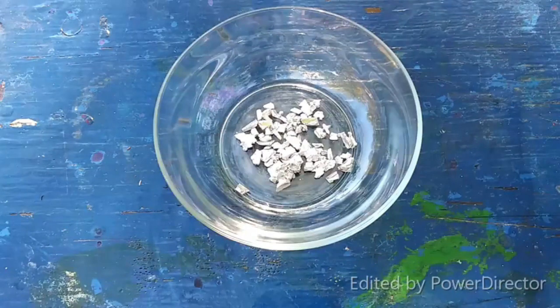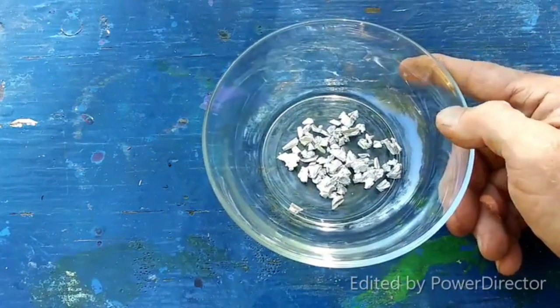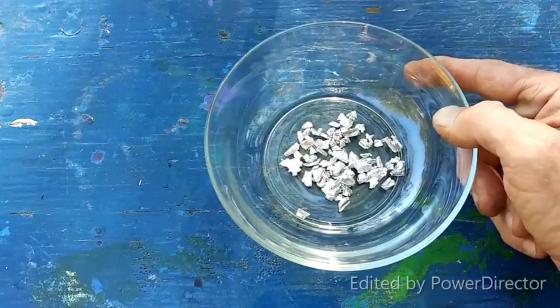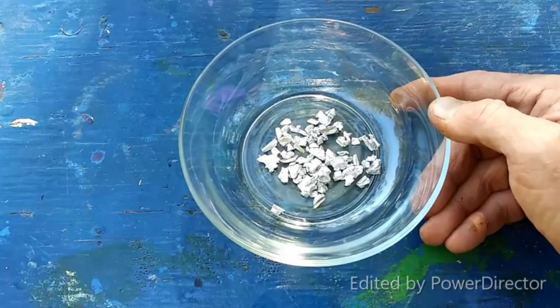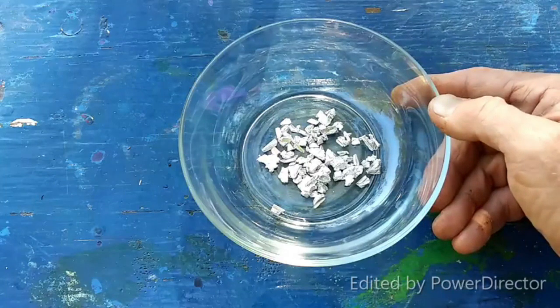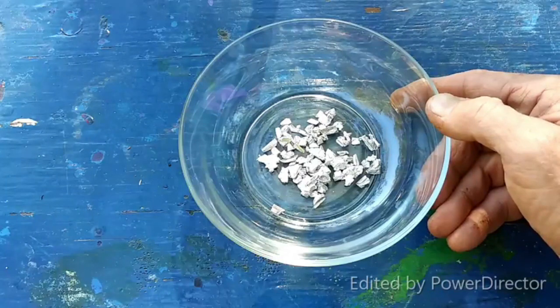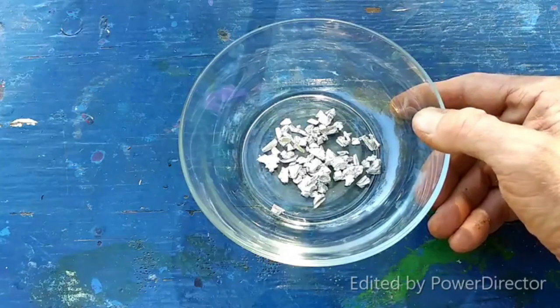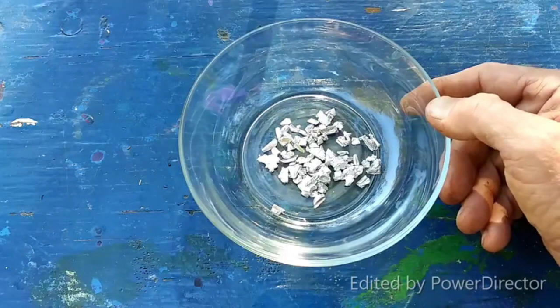The plan is to take some indium metal — there's a little over 21 grams here, purity should be over 99% — and react it with the hydroiodic acid I made in a previous clip to produce indium triiodide. Then we'll get that to crystallize and dry out, put it in a flask with xylene, and add indium metal cut up into small chunks.